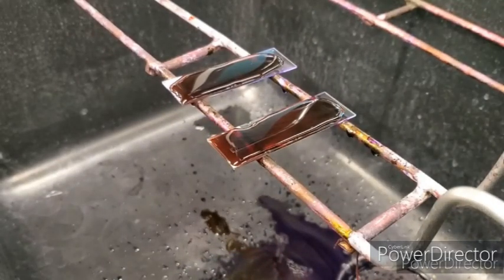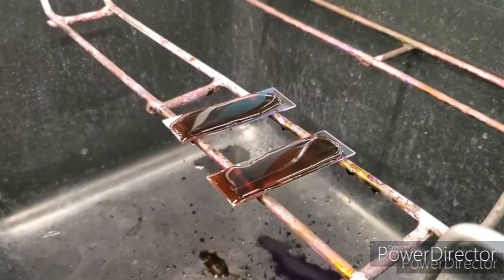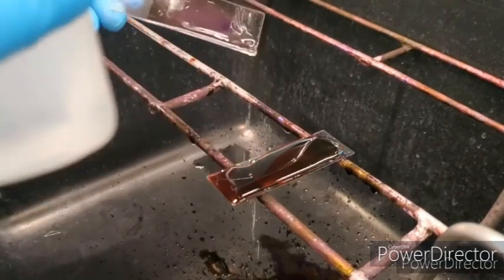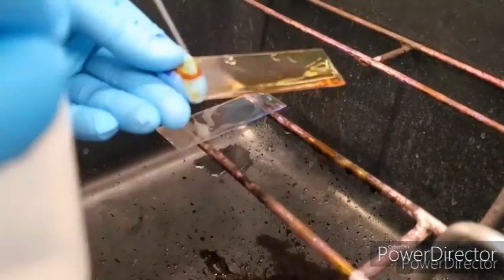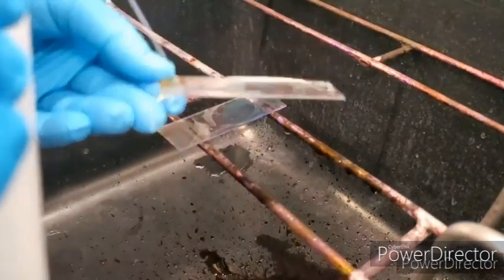So I apologize that I didn't film this. I thought I originally did, but I am already on the iodine step. I did do the crystal violet step, but for some reason my camera didn't film it. So it's been a minute. I'm speeding it up for video purposes, but I'm rinsing off my iodine, and you can see it's kind of purple. So I did do crystal violet before this. I did crystal violet, and then I rinsed, and now I'm doing the iodine and rinsing.